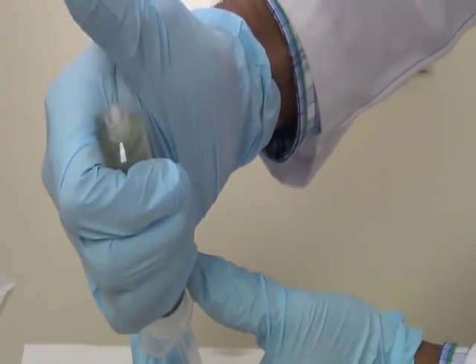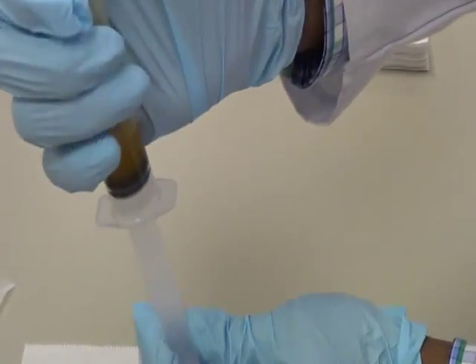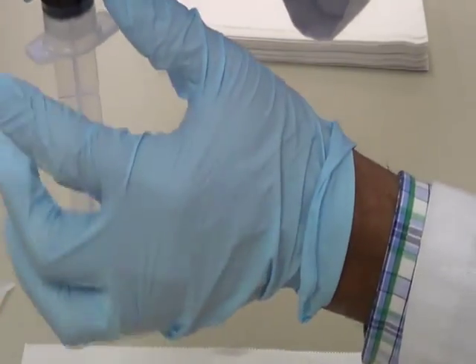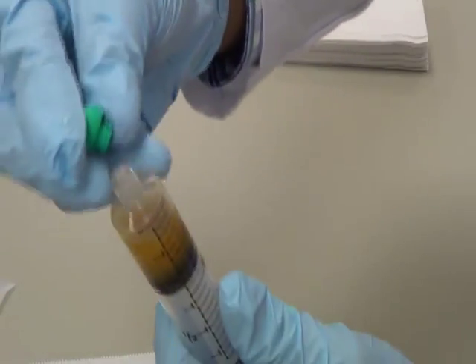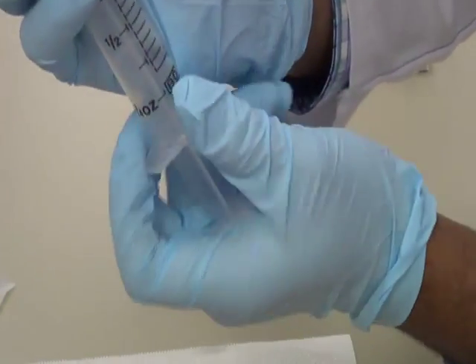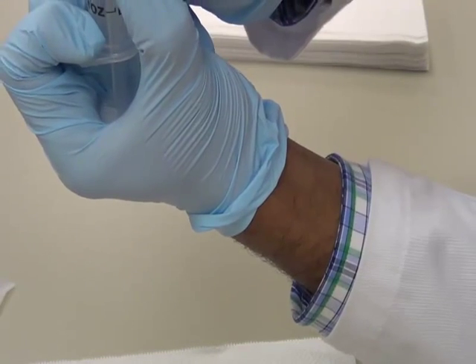And now flip it upside down like this. Hold your finger on top of the tip of your syringe and slowly push your plunger up. The other way to do is use your tip. Loosen it a little bit and push it slowly.